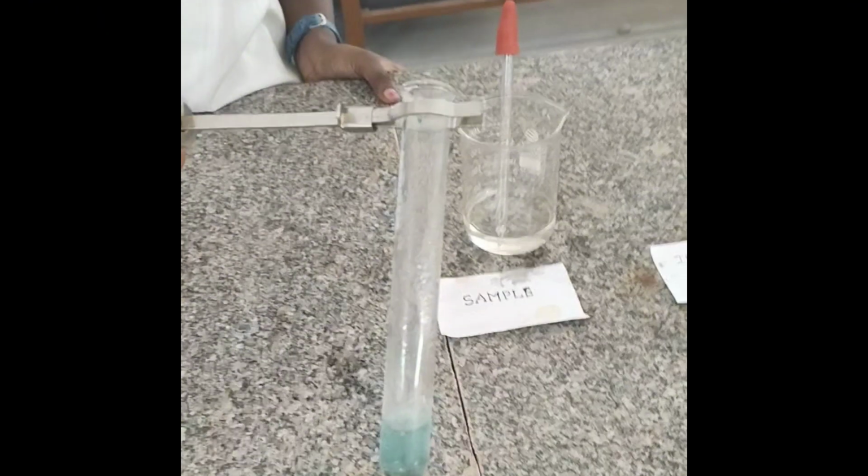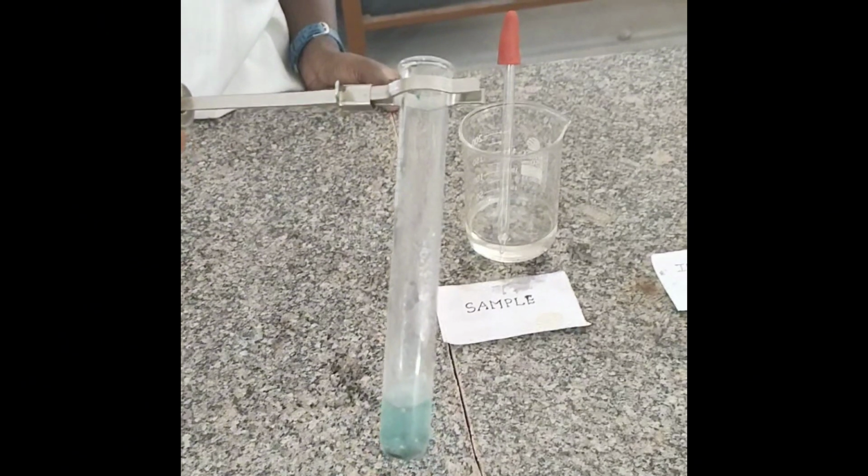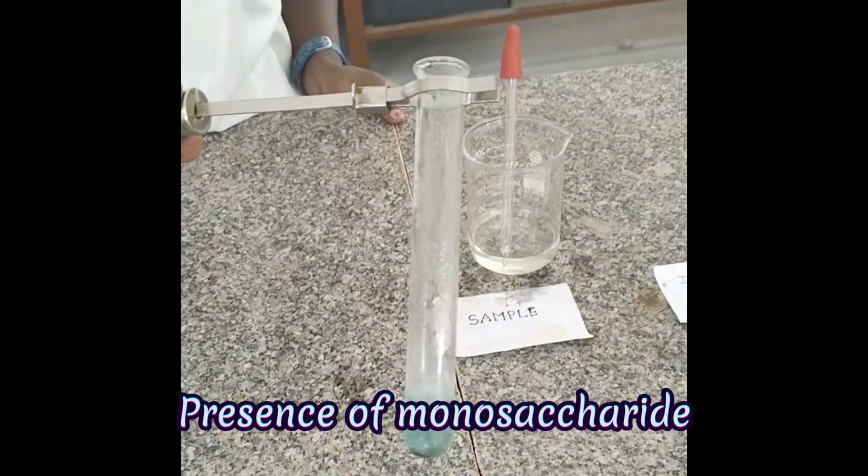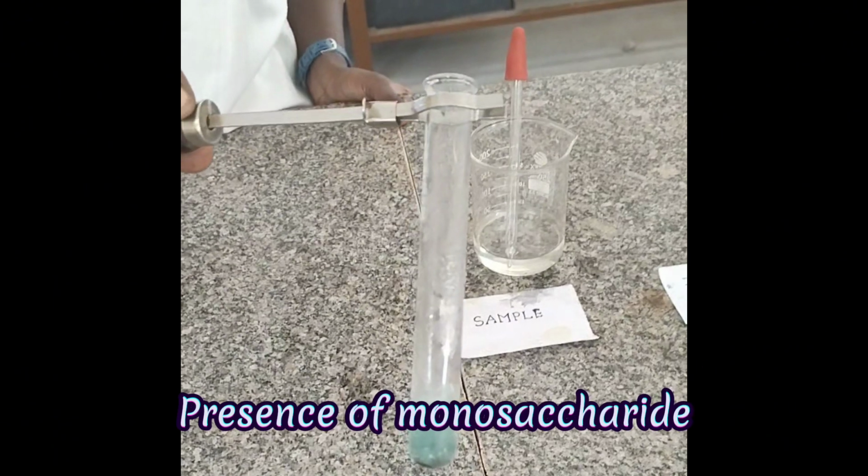Observation: a red precipitate is formed at the bottom of the test tube. Inference: presence of monosaccharide.